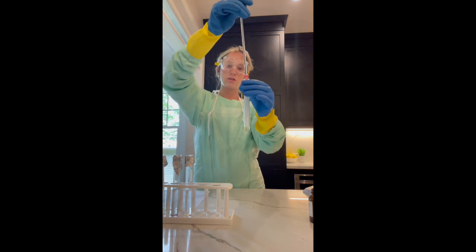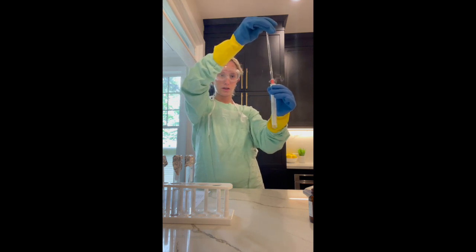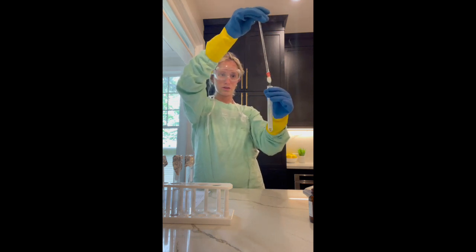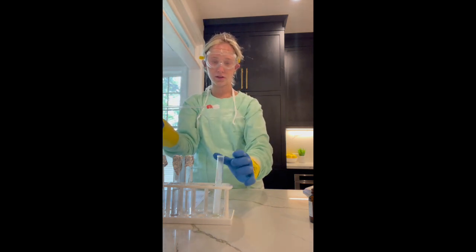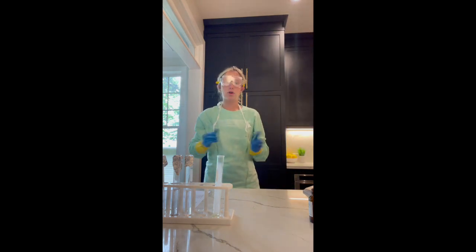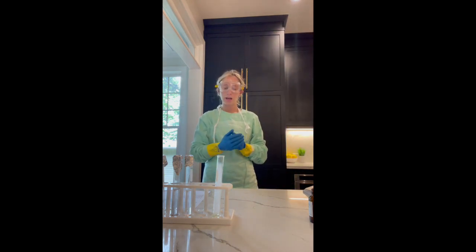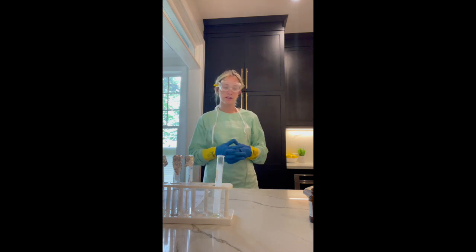Smoke. Okay. Oh yeah, there's a lot of it. Okay. So now I'm going to dispose of all my chemicals properly, and then at the end of this video I will add my analysis and all of my lab notebook pages and explain them.